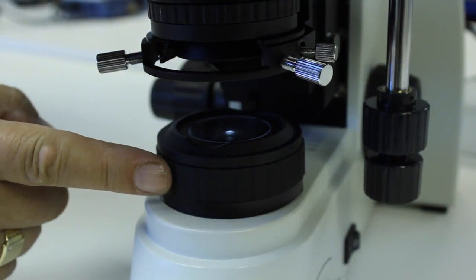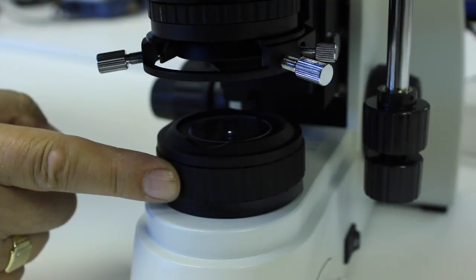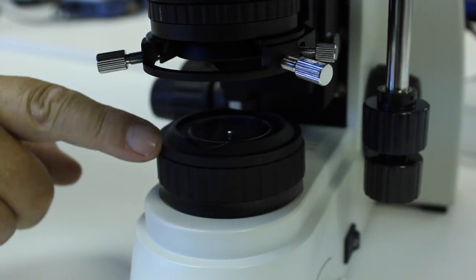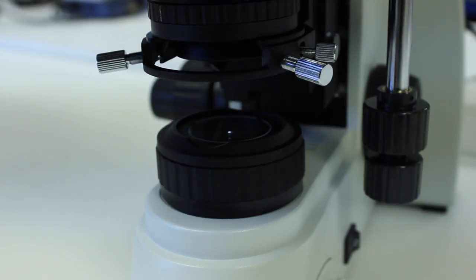You'll just see a tiny spot of light coming through the center of the closed iris diaphragm.